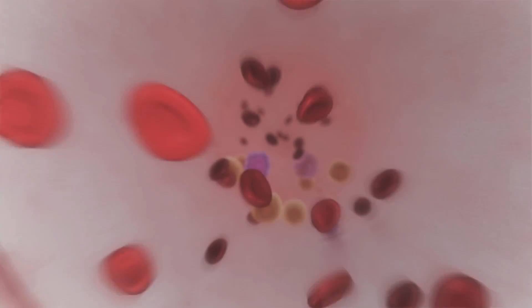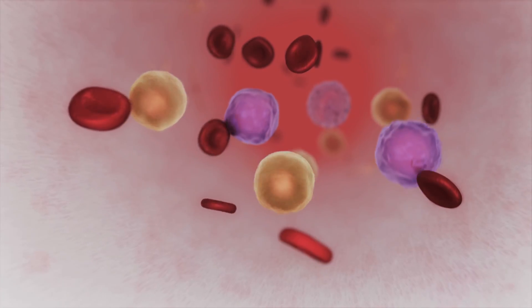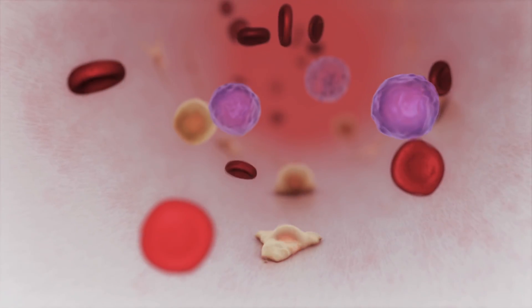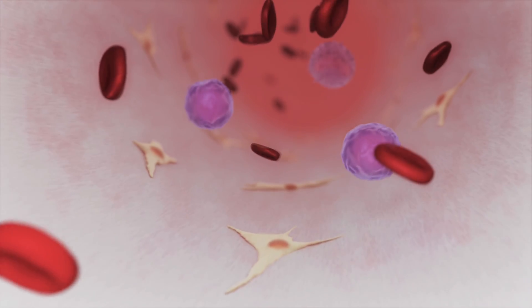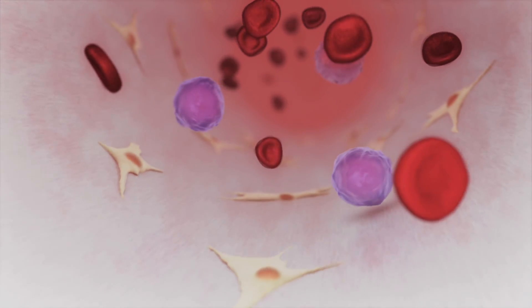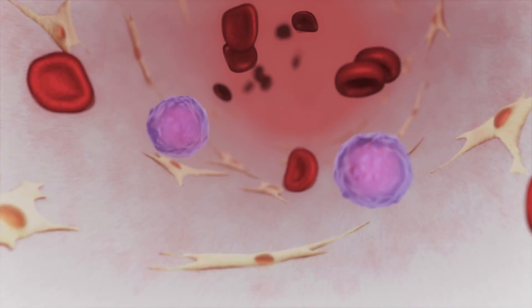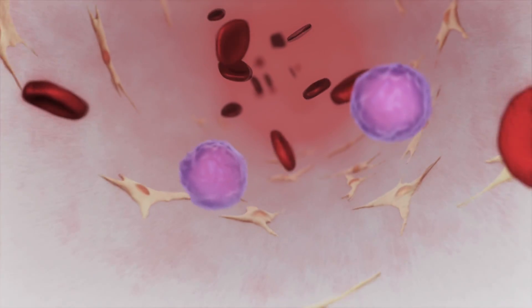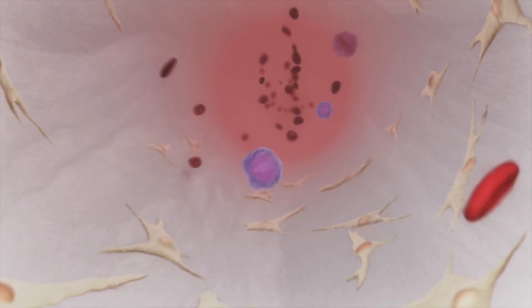For adherent cell production, cells attach and proliferate on the inner surface of each fibre. Suspended cells can be flushed from the system, leaving the adherent cell population for expansion.